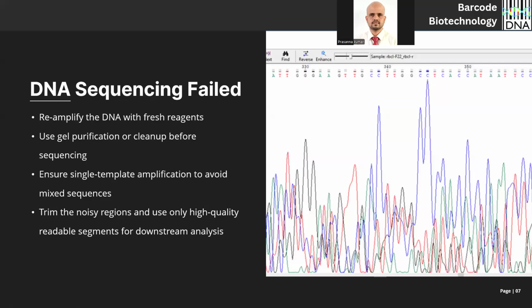Why? Because the peak heights are all nearly 50% of the chromatogram height, right? If you have more degraded DNA, or more dNTPs uncleaned in your PCR amplicons, you may have a background noise, baseline noise. The noises should be here. When you have a chromatogram like this with background noises, it is very much sure that this is a mixed culture. Now the problem starts.